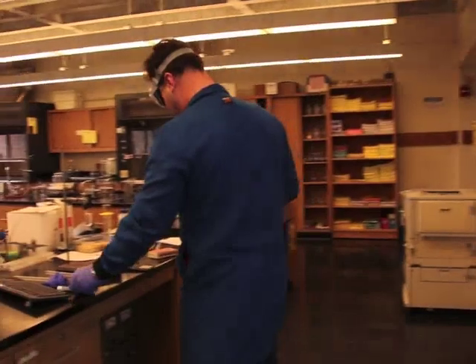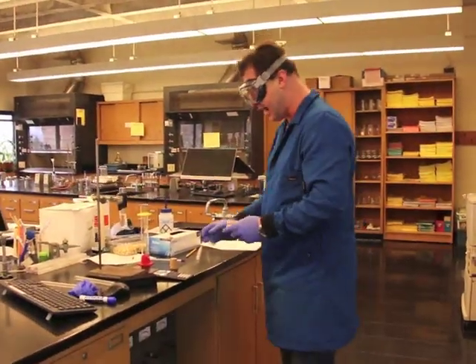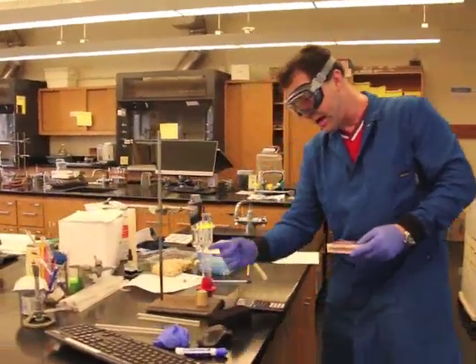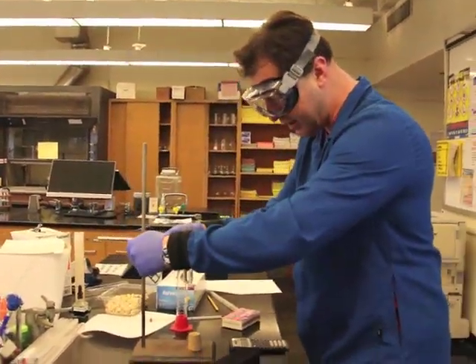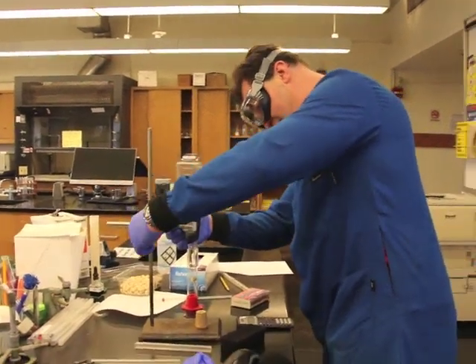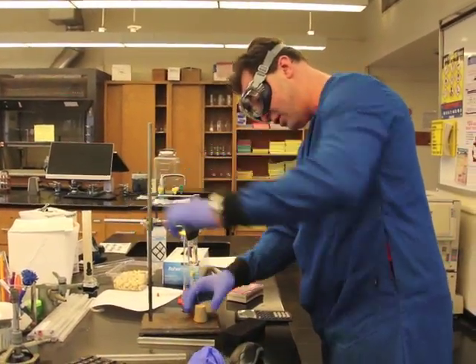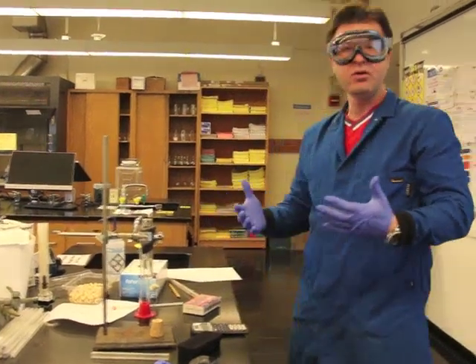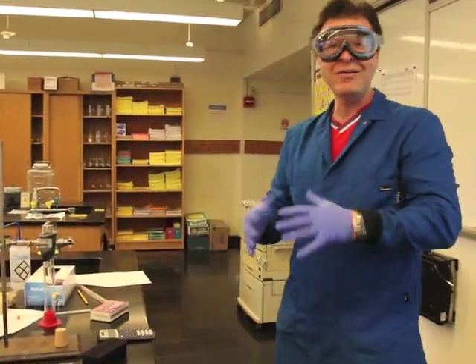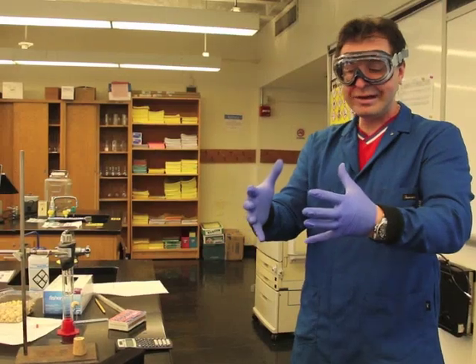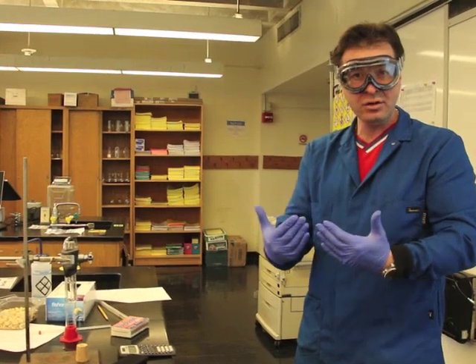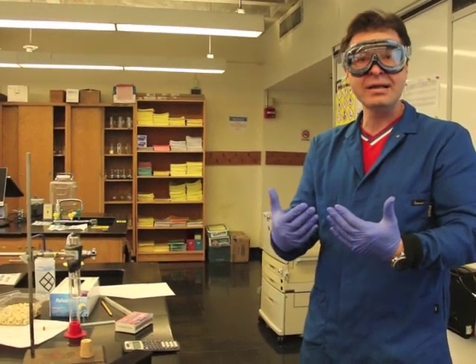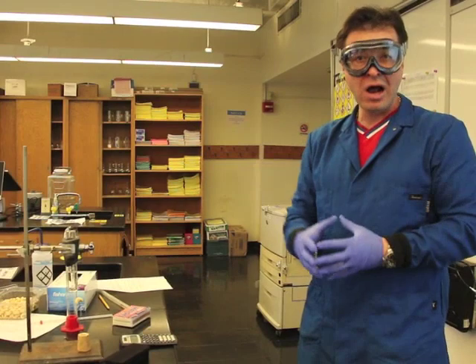The next thing I have to do is burn this cashew. The procedure is very straightforward. I have to position this within two centimeters. This is a very crude calorimeter. Usually a calorimeter has an insulated system where it captures heat without releasing it to the surroundings.